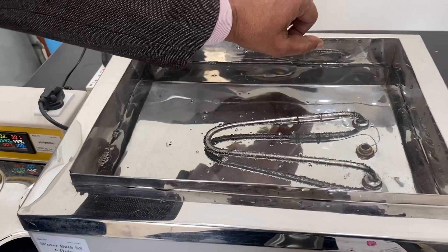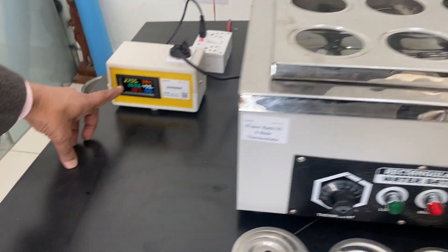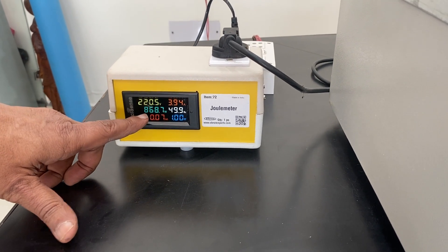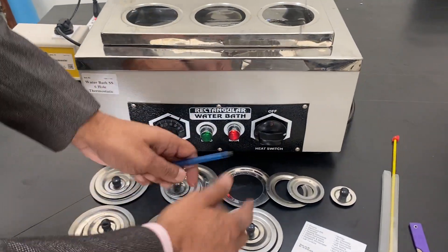You can put the water up to this level. Now this is the lid. The wattage is coming — almost 3.97 amperes and 870 watts is the wattage.